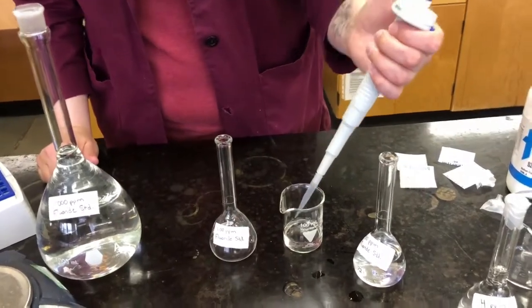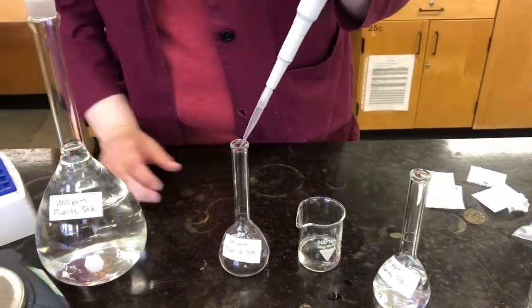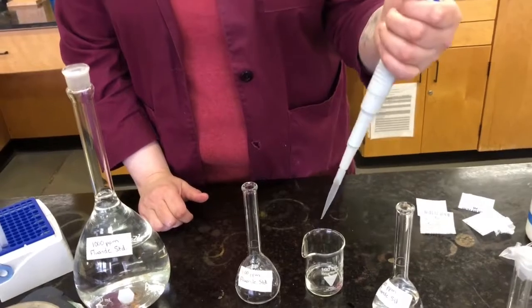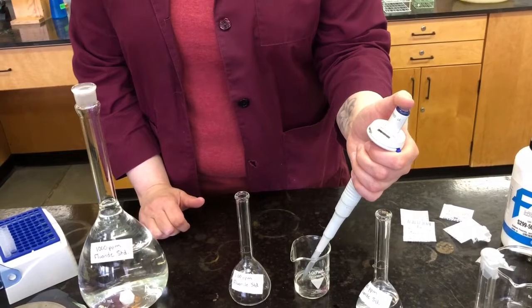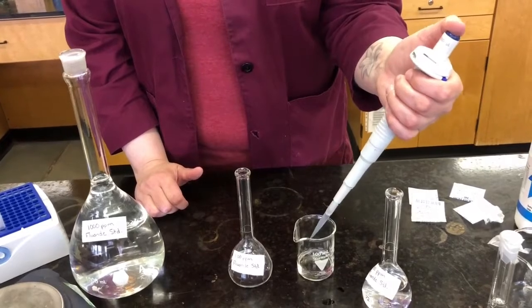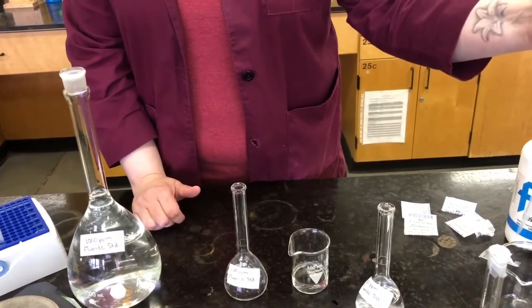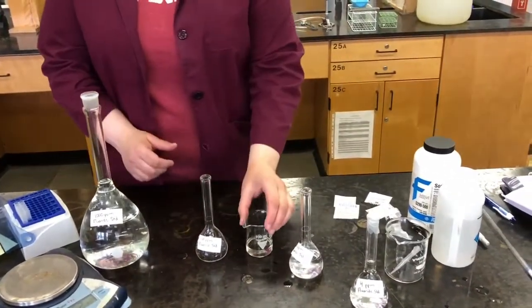Okay, so we're going to take 1 milliliter, 1,000 microliters, put it into our next volumetric flask. And when you use your Eppendorf pipette, you push down to the first stop, put it under your solution, let it come up. When you're going to take it out into your solution, and I'm not going to do that again because I just did it, but just to show you, you go to this first stop, and then to get the little drop off the tip, you go to the second stop, and that comes off. The third stop removes your tip. Okay. So the Eppendorfs are useful when you get into smaller amounts.